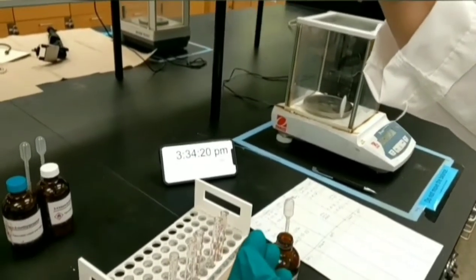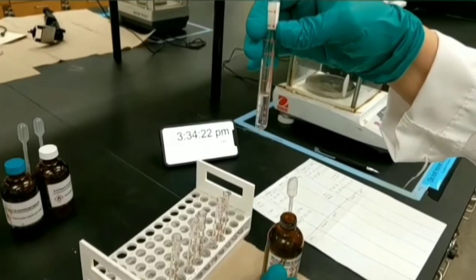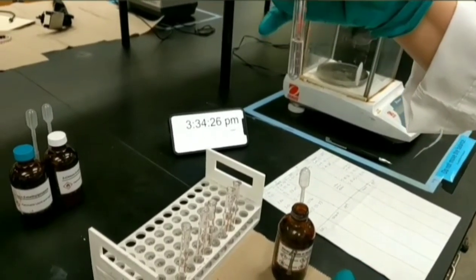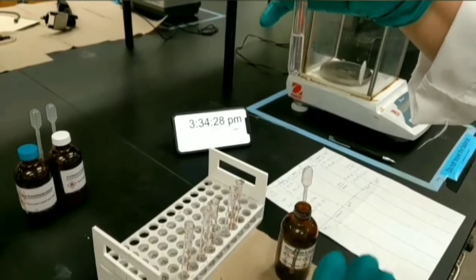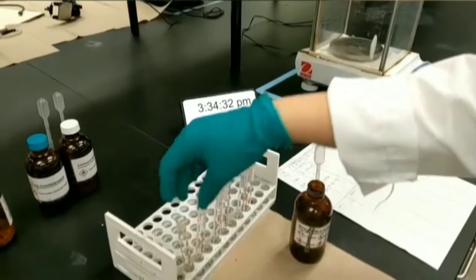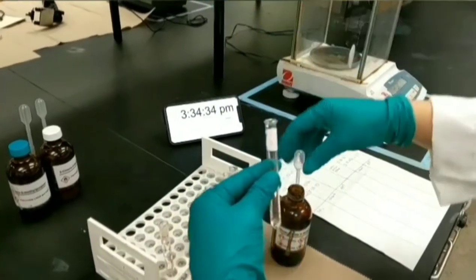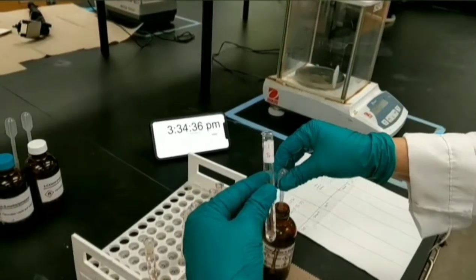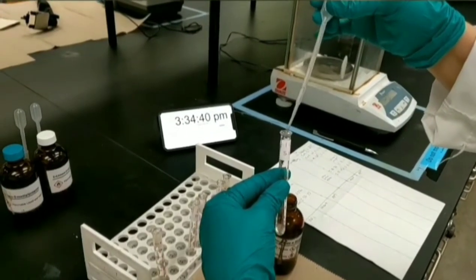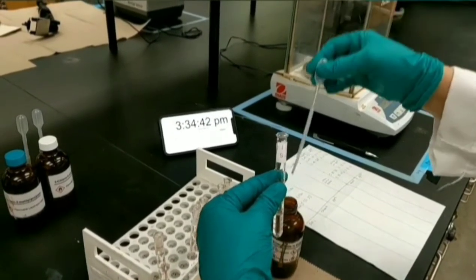It's a primary alkyl halide and it's not a good reactant for doing SN1 reaction. I can keep it in the rack and check it later again for any precipitation. I'm going to add 1 ml of nucleophile to 1-chlorobutane. Record the time immediately.